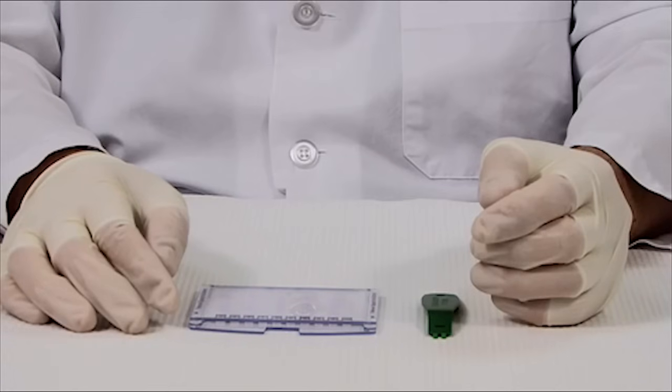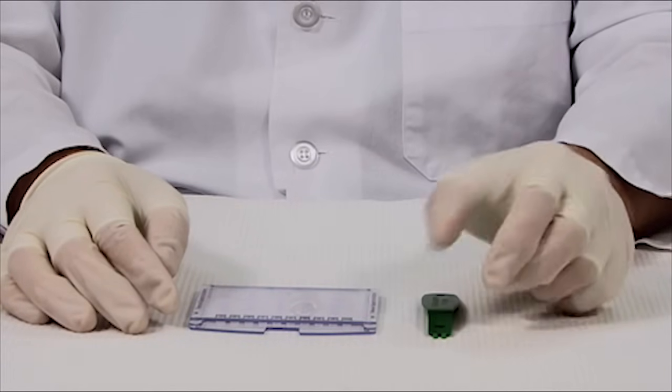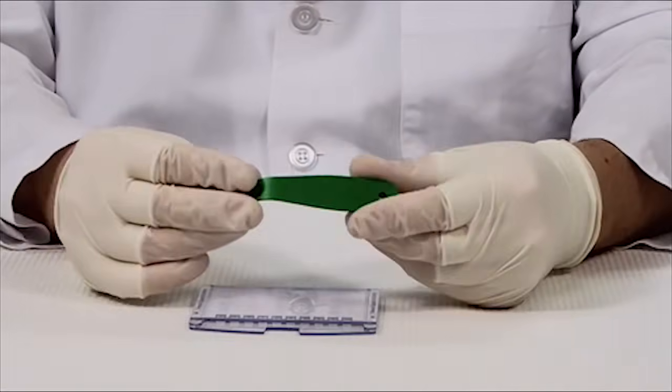The next step is to open your TGX gel cassette. To do this, use the opening lever that is supplied with every box of gels.